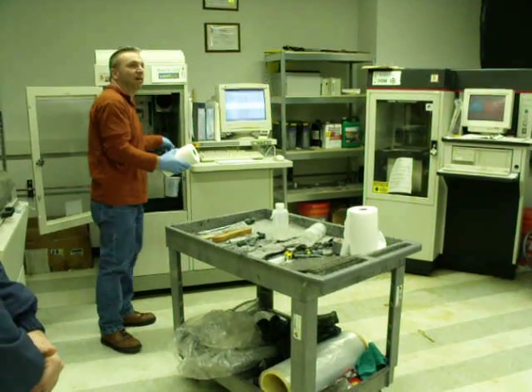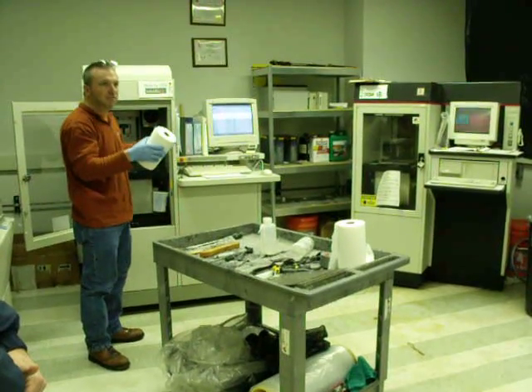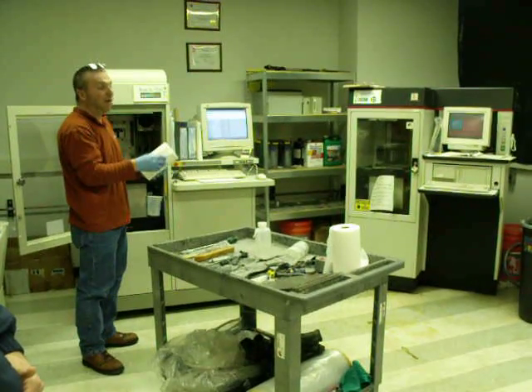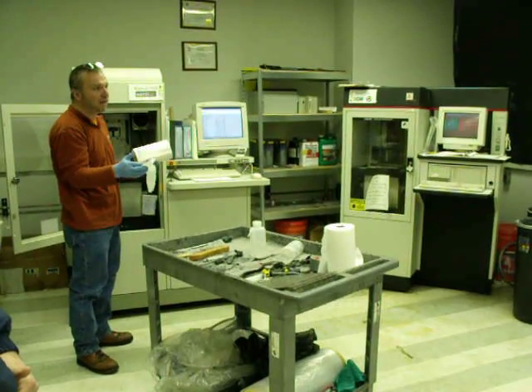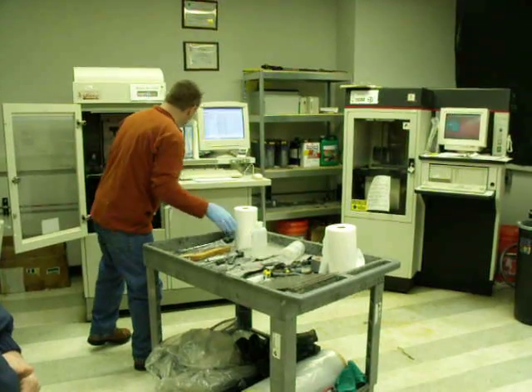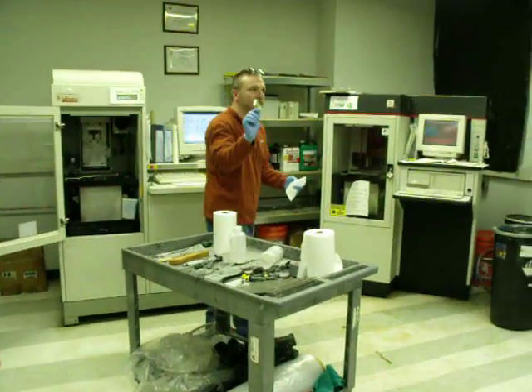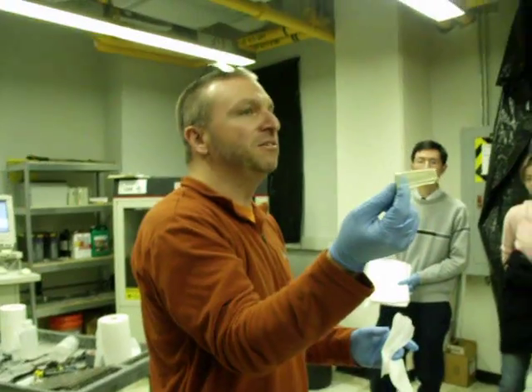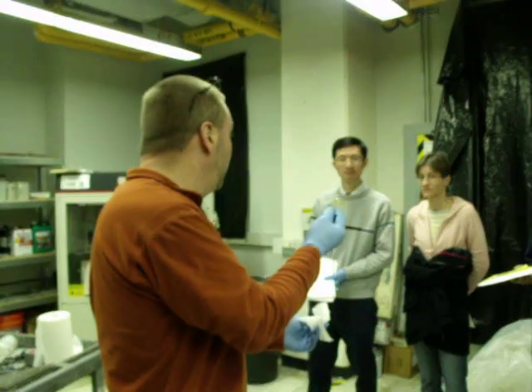I'm really surprised that we haven't gotten resin on the lenses, on these mirrors, where the laser finds its home position. Because if you get resin on that, you're done. And really, you can't wipe these things off with a standard paper towel because it's probably going to scratch, and you've got problems there also. So we should have. And now we have these, but these were made to protect those lenses. It's covered with resin because resin's been spilled in the bottom. So you can't really use this. So we really need to clean these.